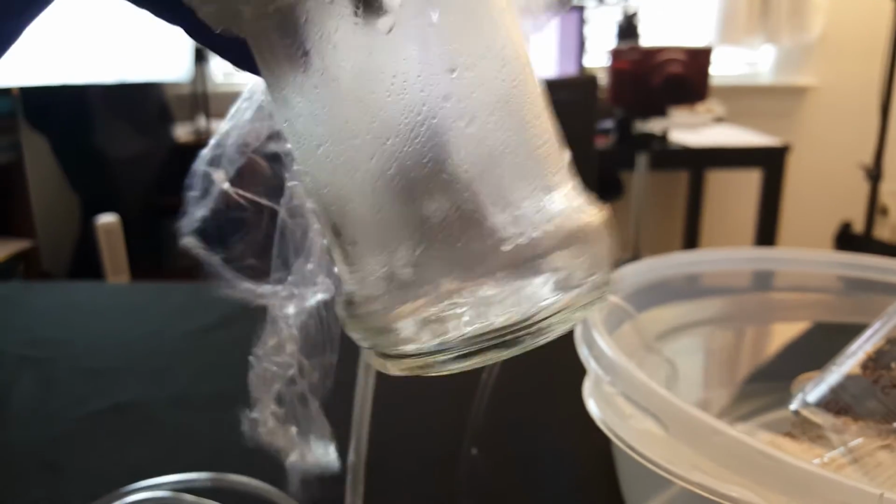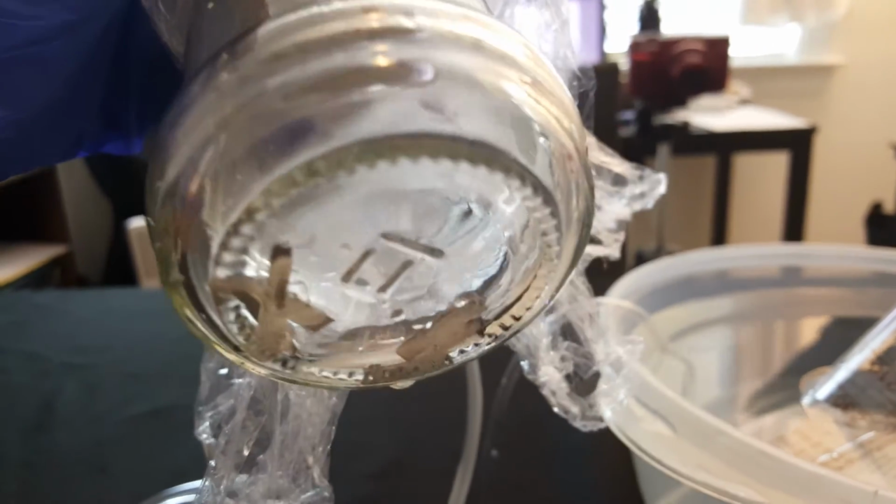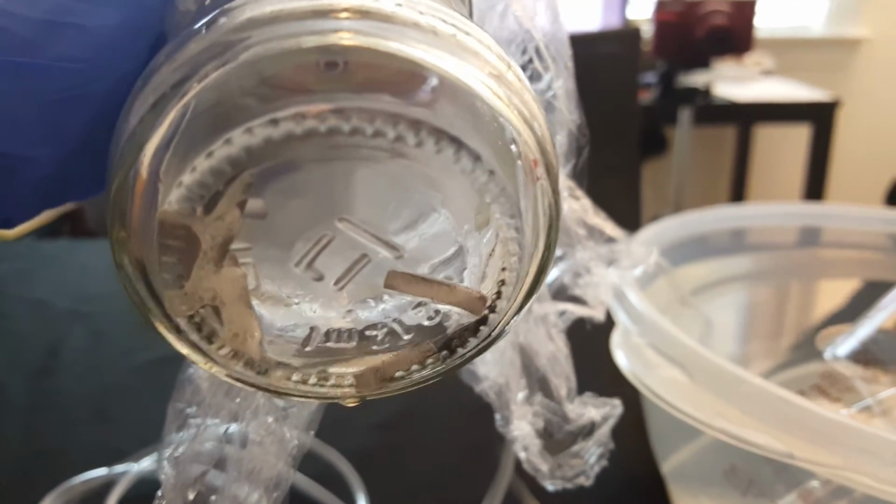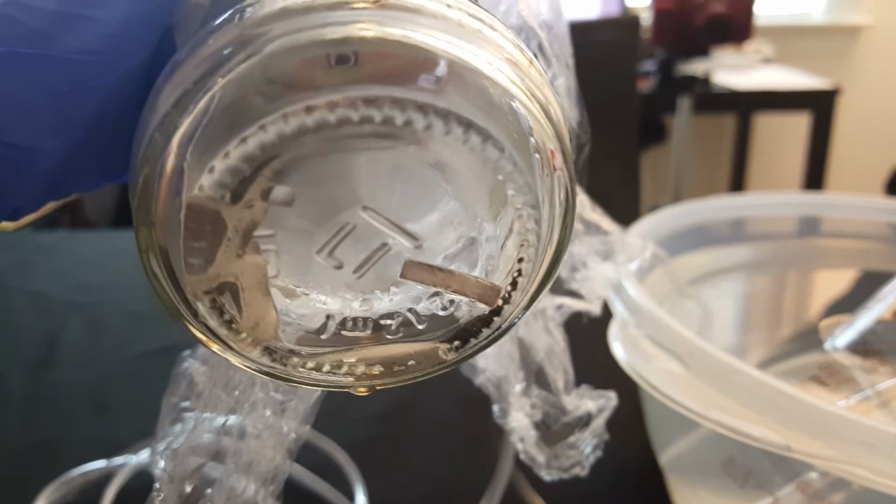The magnesium ribbon hasn't completely dissolved in the hydrochloric acid, so we know that there's probably more magnesium in there than just the 0.2 grams, but my scale is pretty crappy, so, you know, it's what I've got to work with. There's sources of error right there. You can see the hydrogen gas actually forming.